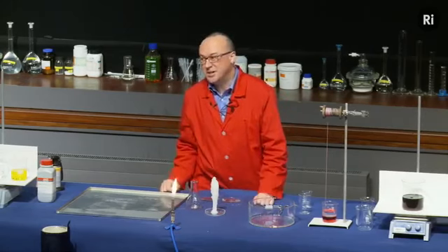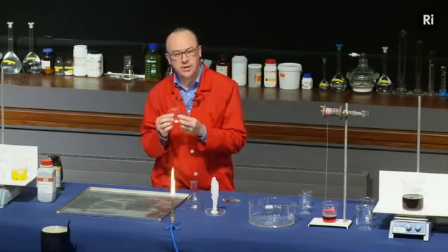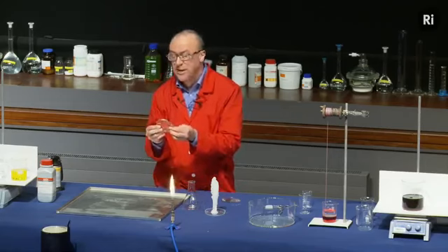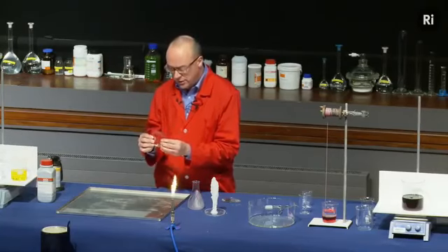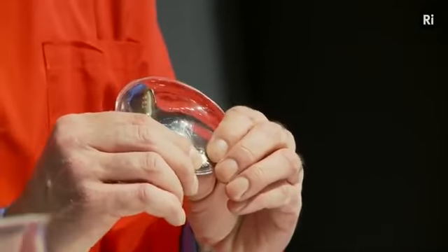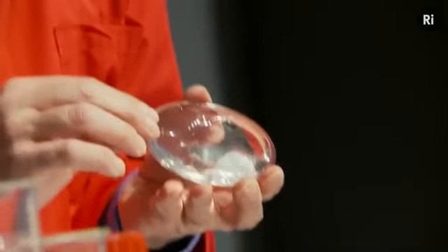Now, oddly enough, this actually has a practical application, and this is the practical application. This is something called a hand warmer, and it's a plastic pouch, and it contains exactly the same liquid as in this flask. It's a solution of sodium acetate, and it would like to turn into a crystal, but it needs an excuse to get going. And the excuse is this little metal disc, and if I just flip this disc backwards and forwards, that should be enough just to start the crystallization off, and there it is.